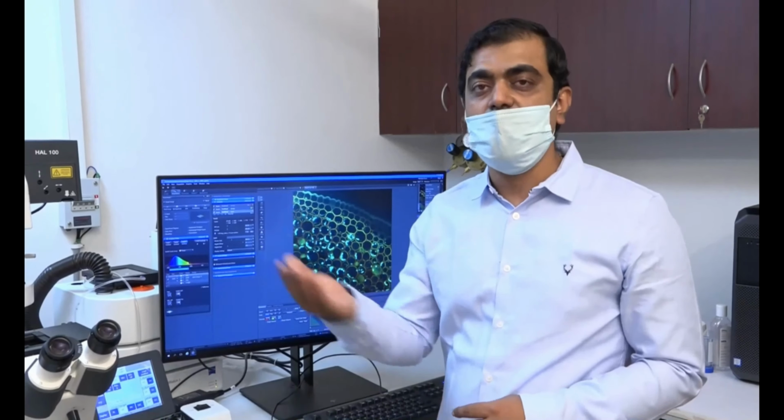So you can see here from this 1528 to 1575 is the range which has a thickness of 46.18 micron. So the sample is 46.18 micron thick, where the software will automatically tell based on the optics I am using, the objective I am using, the numerical aperture, the resolution capacity of that objective.